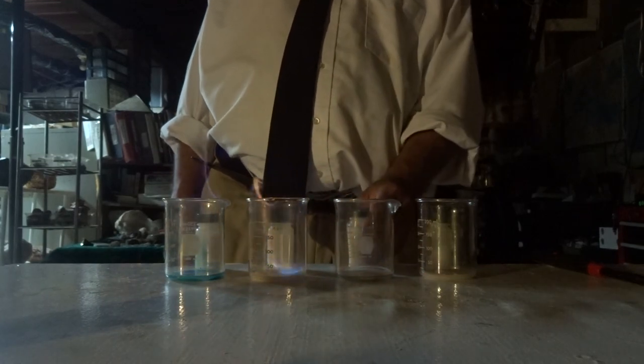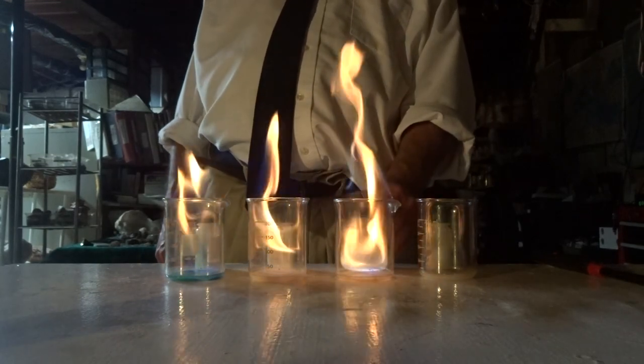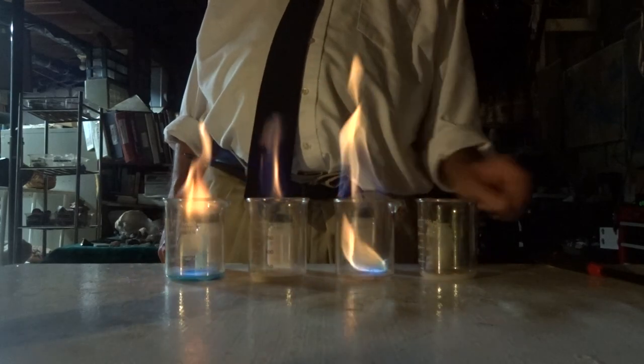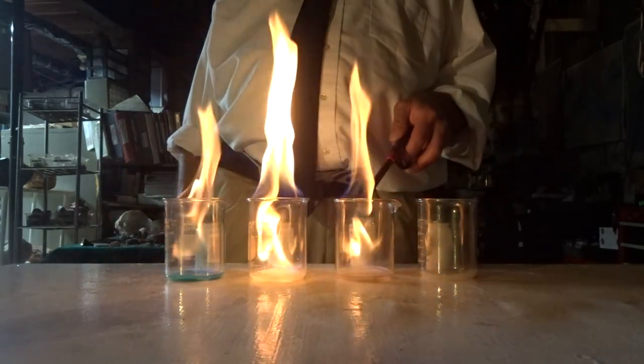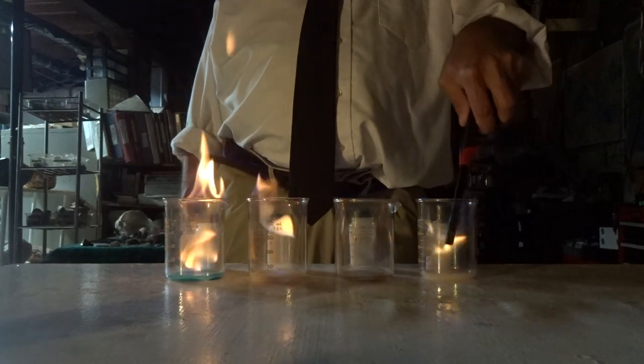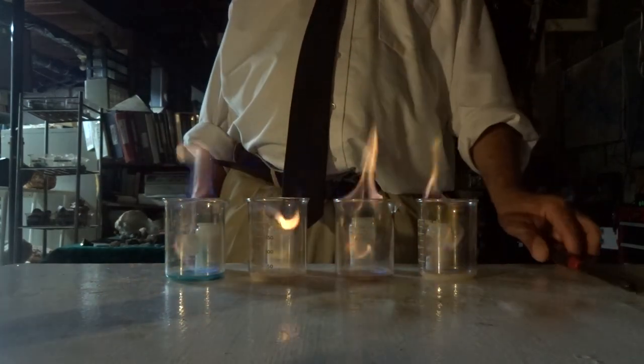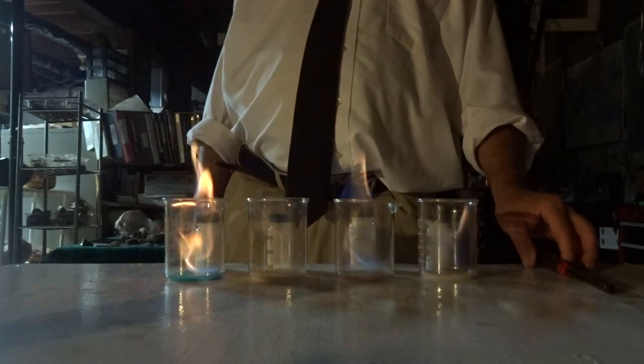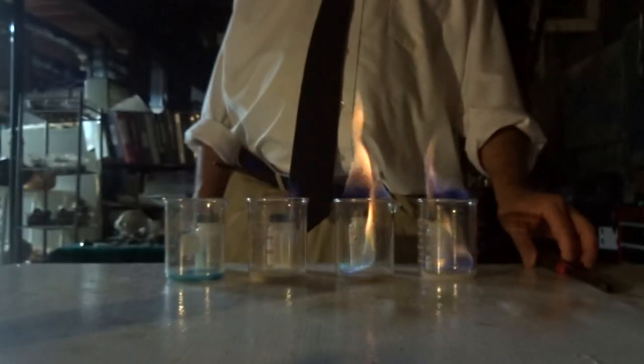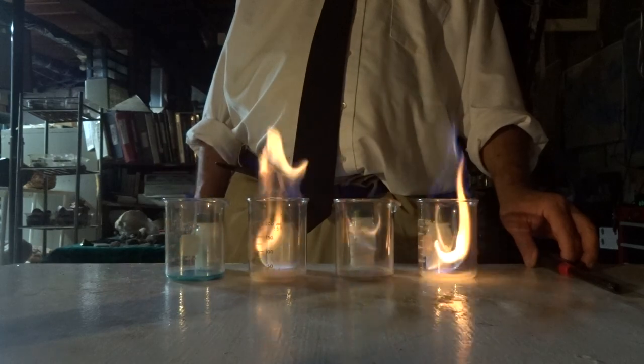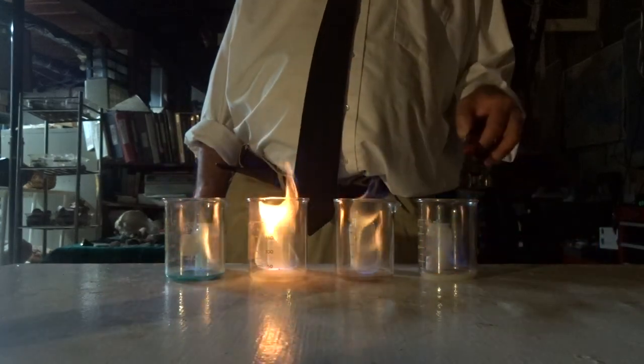We can see boron starting to flame green. This is boron. The sodium is flaming yellow.